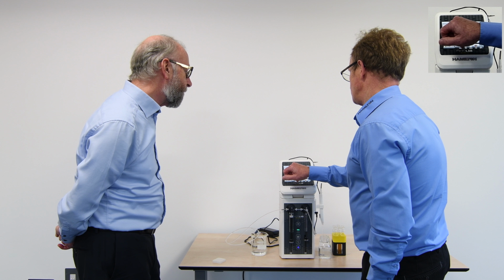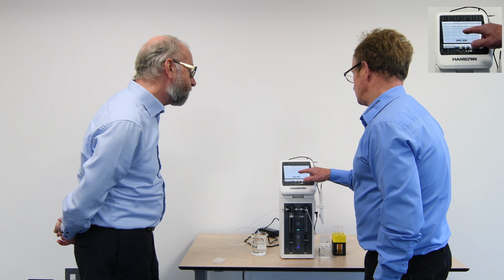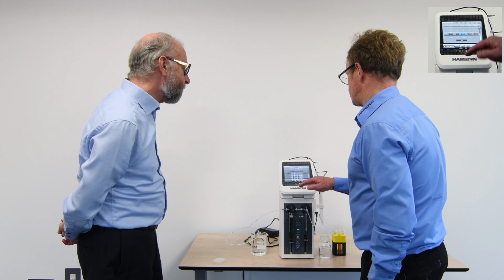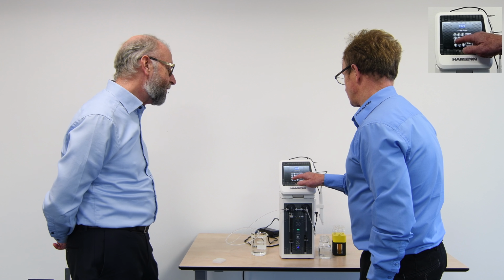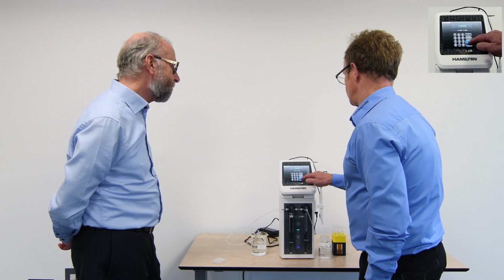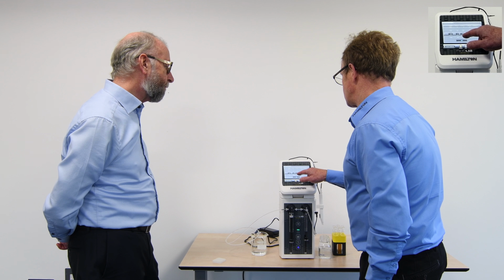And we can see it was automatically aspirating here 5,000 microliters. If I wish to, now I can highlight that volume and change that maybe to 10,000 microlitres. I've gone in and entered that as a figure, and we can change the volume here.